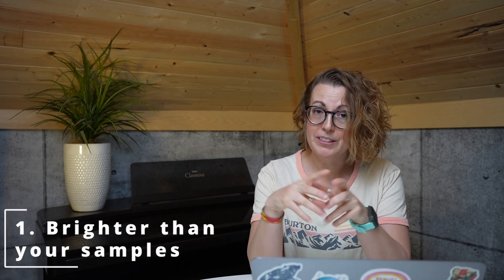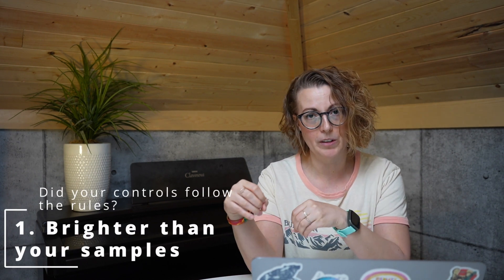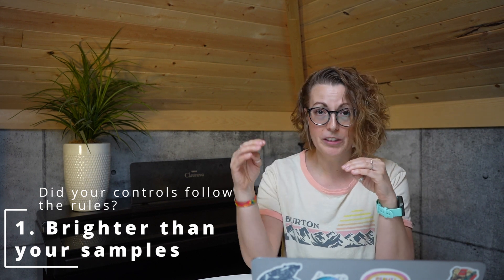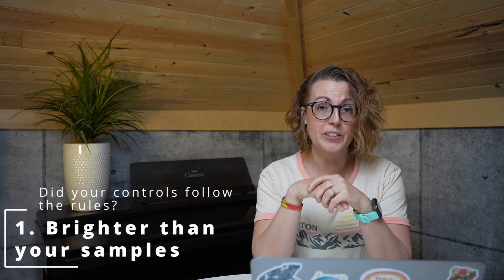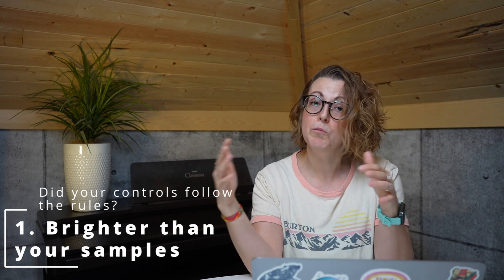So you think your compensation matrix is bad. The first thing I would recommend doing is going back to your controls and checking to make sure that they followed all of the rules. Generally, when you see poor compensation results, something is off with your controls. First, double check that all your controls are brighter than your sample, because compensation can only compensate up to the point where your control was. So if your samples are brighter, there will be errors.